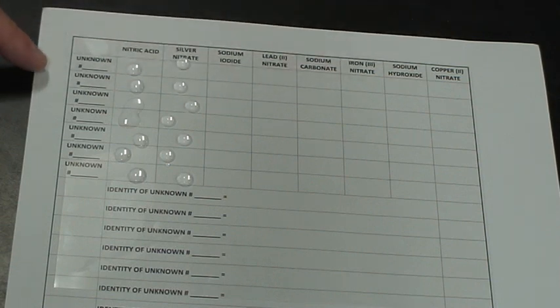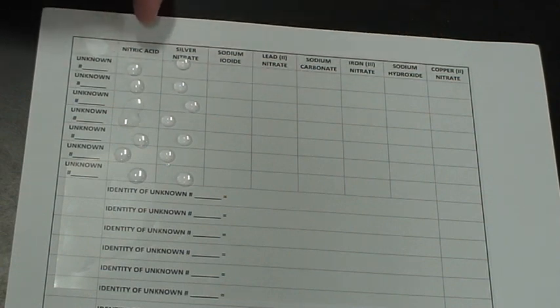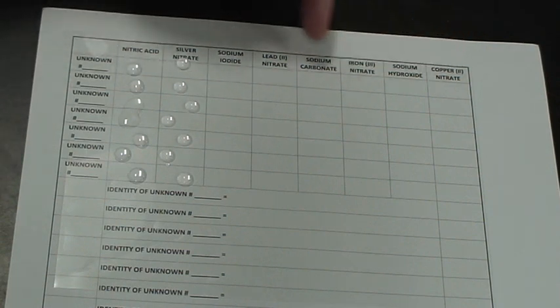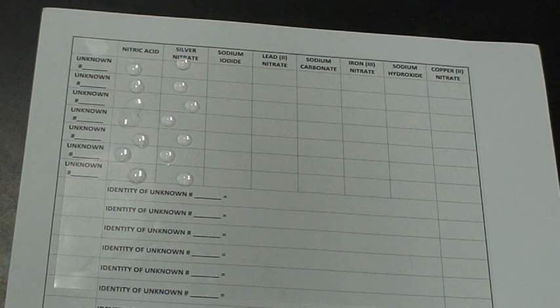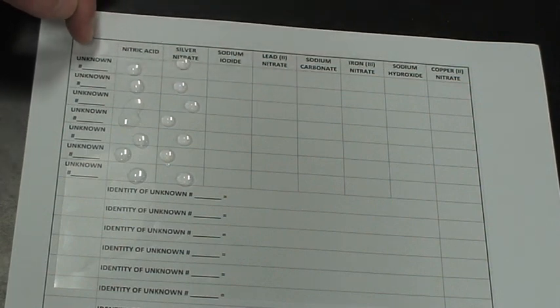Now I'm going to give a word of caution because these unknowns are generated just at random. So it's highly likely that you're going to get some repeats. It is also very likely that you might not have, because you only have 7 unknowns, one of these might not be included at all, and maybe there's a couple in there. Okay, so I don't want to leave anyone with the impression that just because we have 7 unknowns that it's a process of elimination, first of all. But second of all, I don't want you to leave with the impression that you're not going to have any repeats. In fact, it's highly likely that you get repeats.